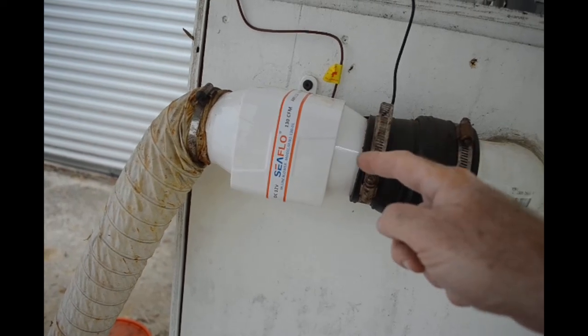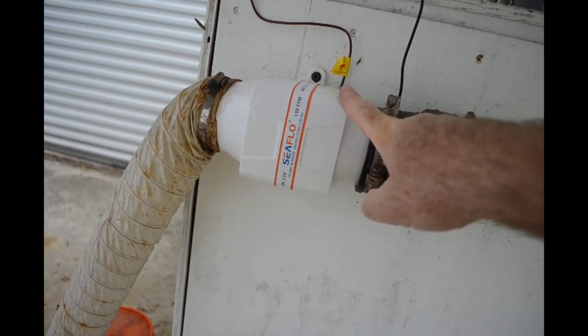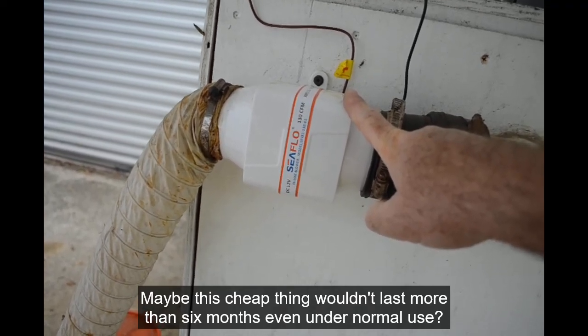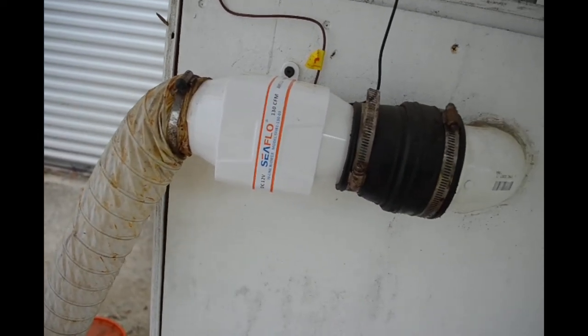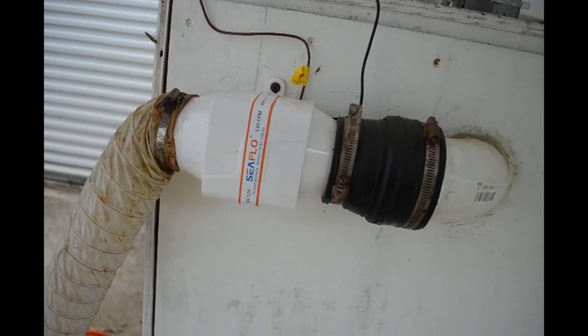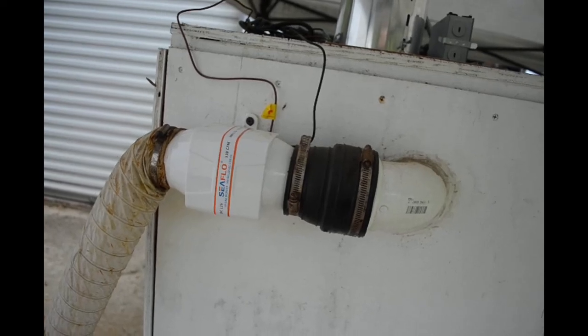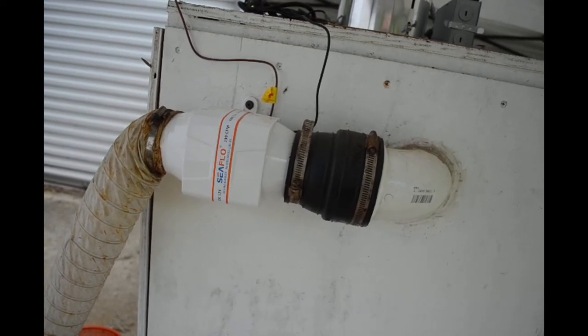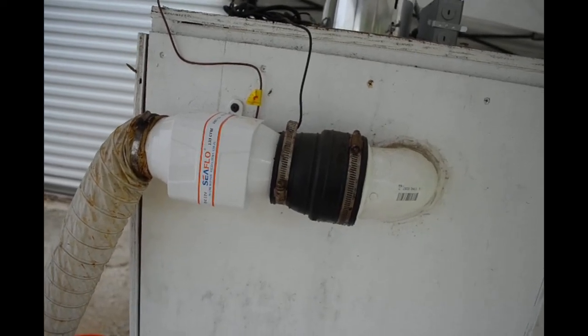I still consider this to be a consumable item but it's so cheap, under $30, and it takes me like five minutes to replace it that I'm not too worried about it. I am using like the cheapest bilge blower I can find on Amazon. Maybe if I bought something a little better quality it would last a lot longer.